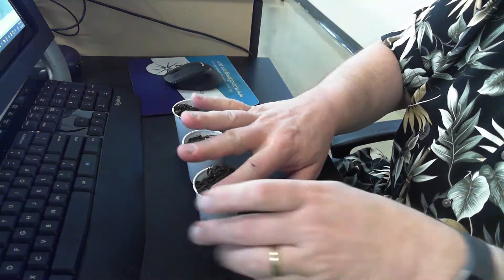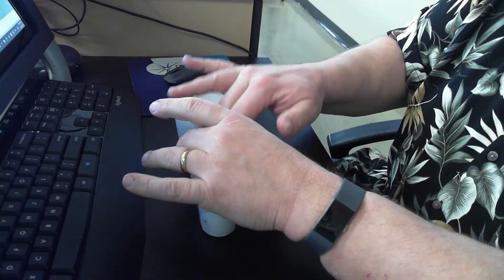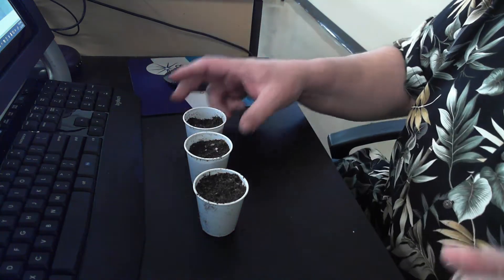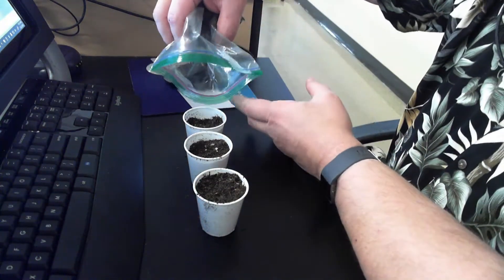All right, so, my cup, I'm going to press that down. A little sparse here.